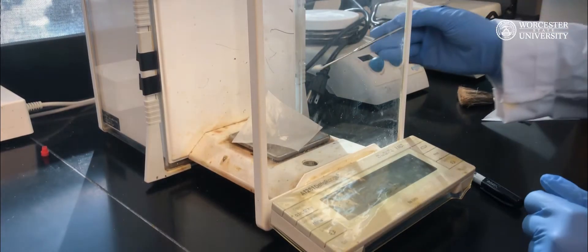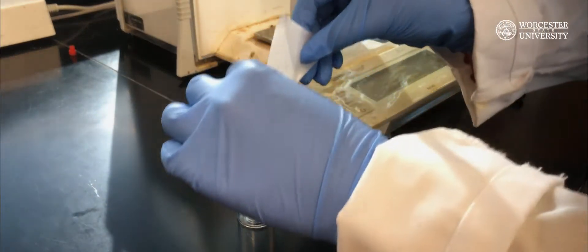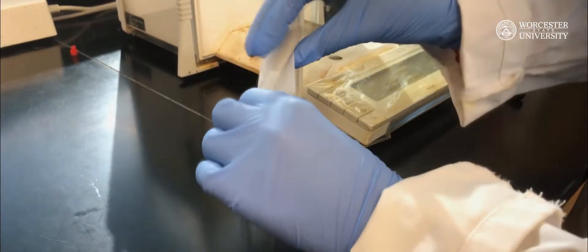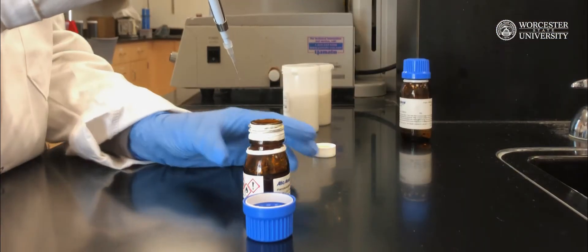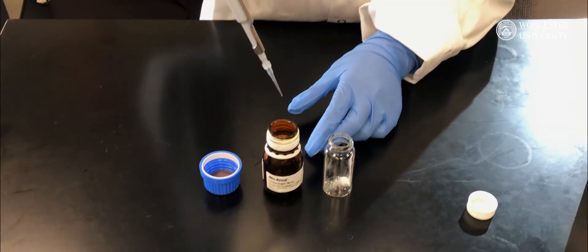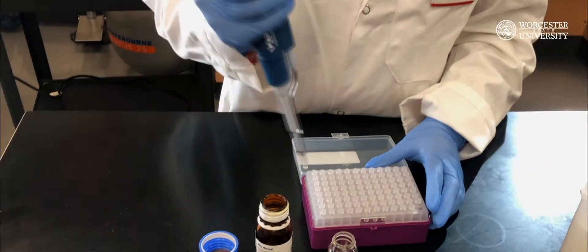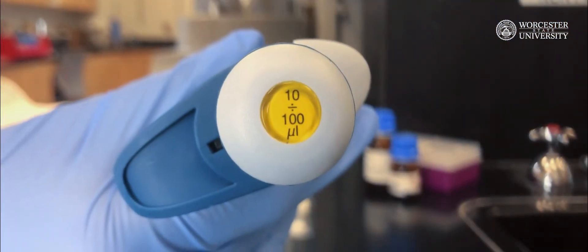To begin, weigh 24 mg of the catalyst bromotris-triphenylphosphine copper(I) and add it to a 20 mL pre-weighed vial. Next, transfer 62 µL of benzyl azide and 55 µL of phenylacetylene to the 20 mL vial. This can be achieved by using a 10 to 100 µL pipette.